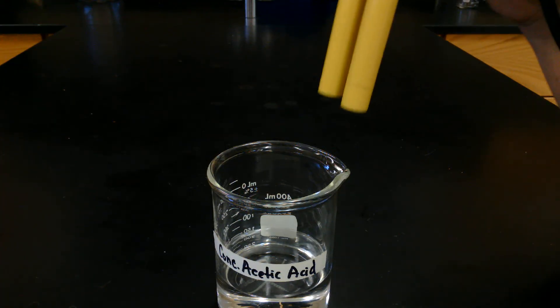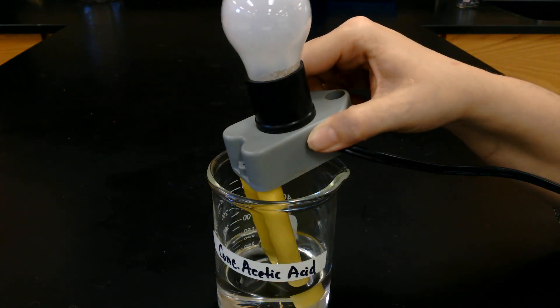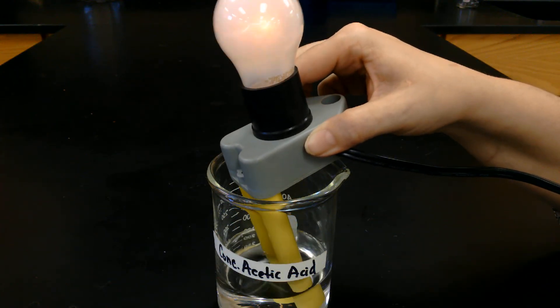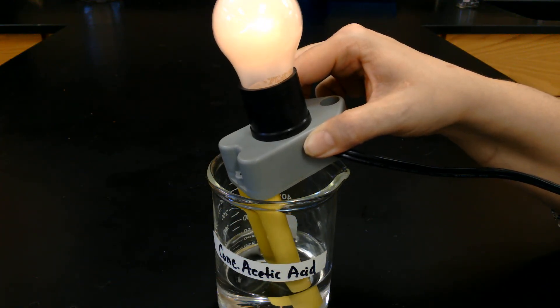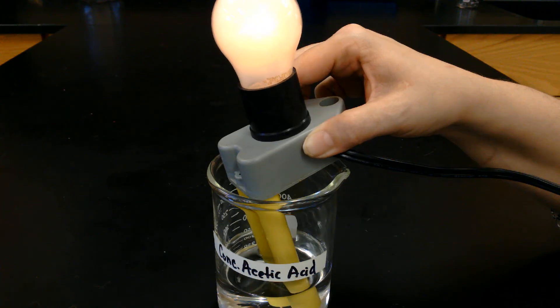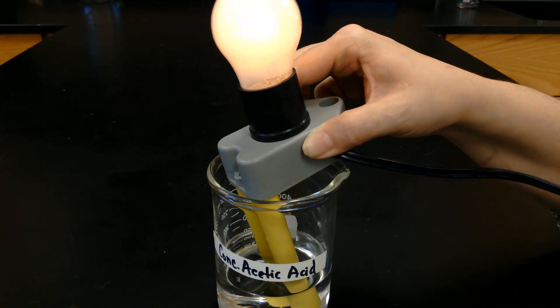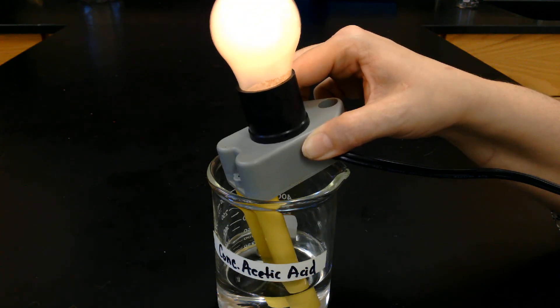Now we're going to try some concentrated acetic acid. Remember, acetic acid is just vinegar. Oh, it's a little dimmer actually. Go ahead and make your observations on the concentrated acetic acid.